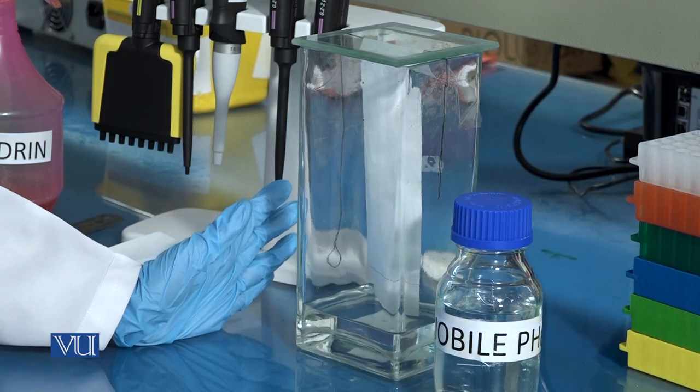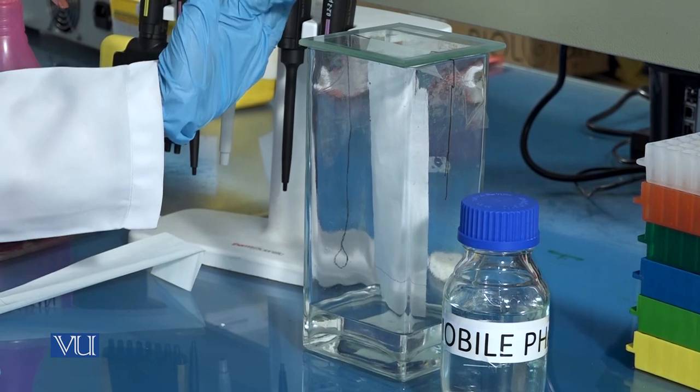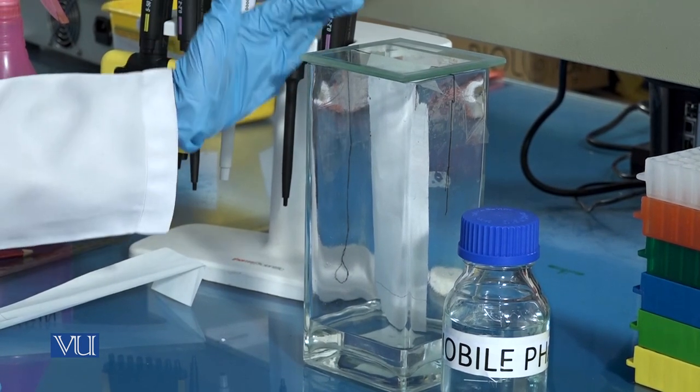At any point during chromatography, the filter paper should not come in contact with the walls of the tank.